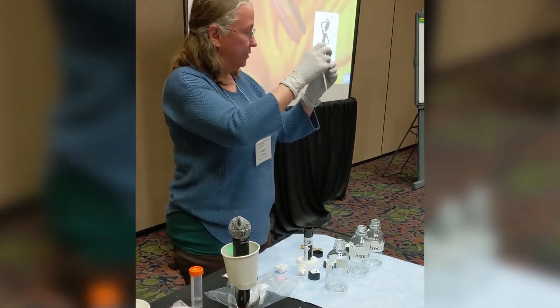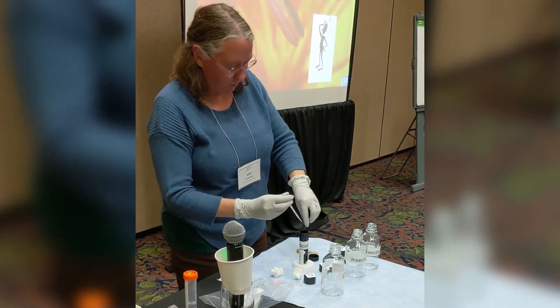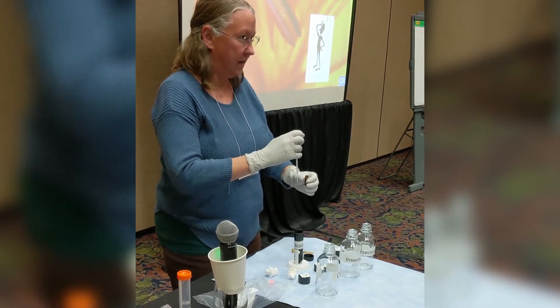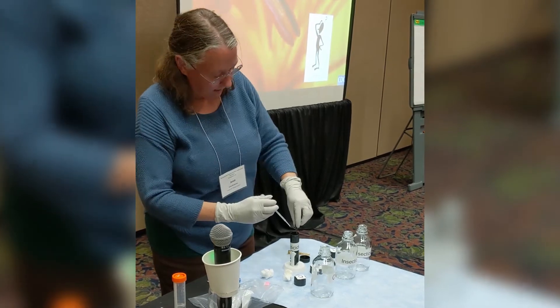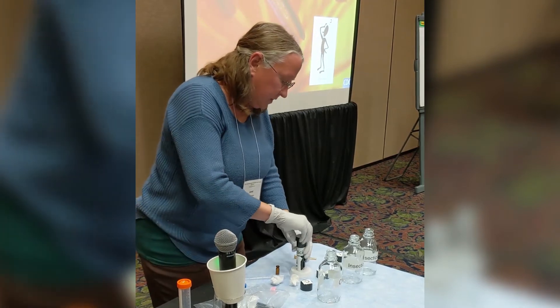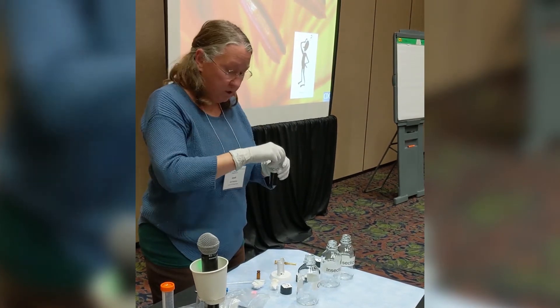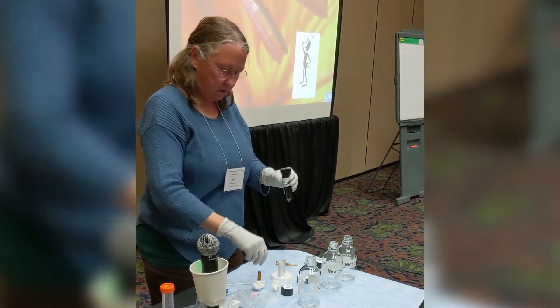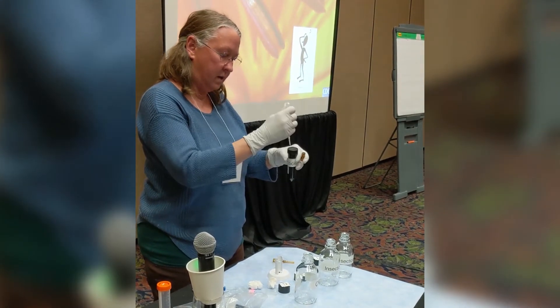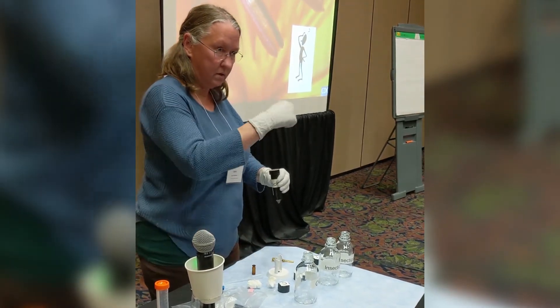After you have opened your insecticide, you can take some of that acetone and rinse the bottle out. You really want to triple rinse it to make sure you get all of that invisible insecticide out and into your mix. Once you have done that and mixed it up, you don't want the pipette to go back and forth — you just want to pour it directly out. You can use that same pipette to treat the bottles.